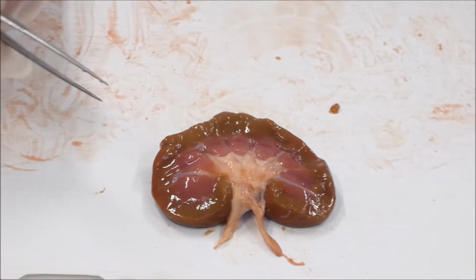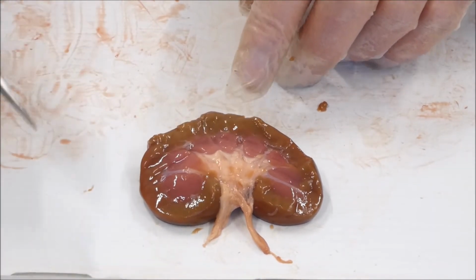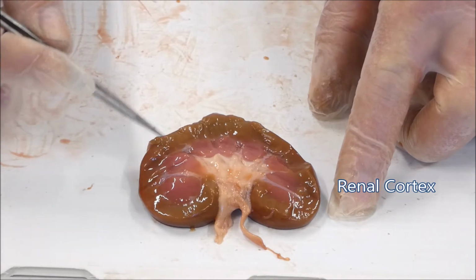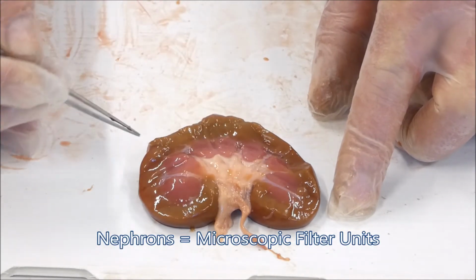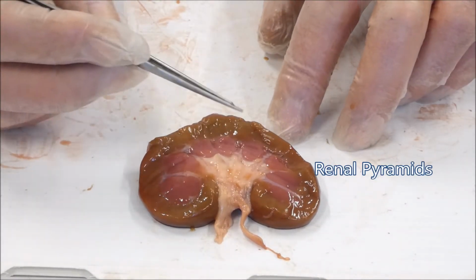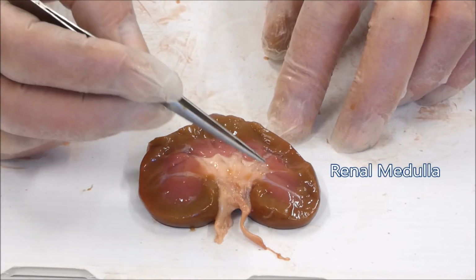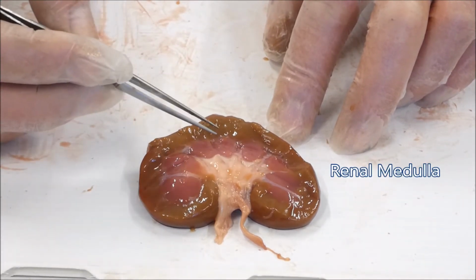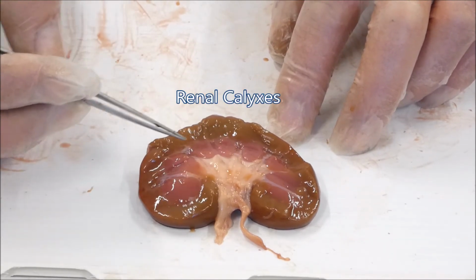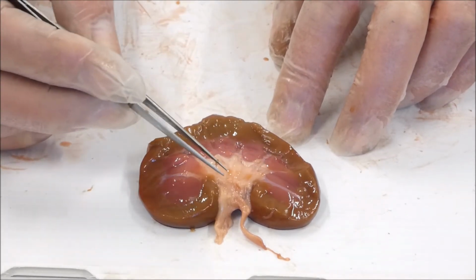It's now time to go through all the different parts and to identify the parts and talk about their structure and function. We go from the renal cortex here, which contains the main part of the nephrons, which are the filtering units of the kidney, which are microscopic. The nephrons have tubules that come down into the renal pyramids, which together make up the renal medulla. And from the tubules you get the waste products filtering out into the calyxes, which are the branches of these white branches coming back down into the renal pelvis.